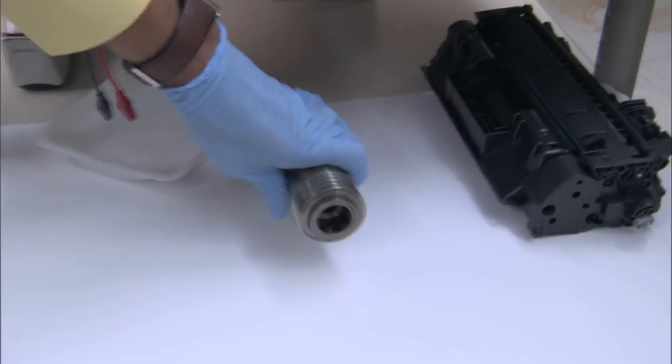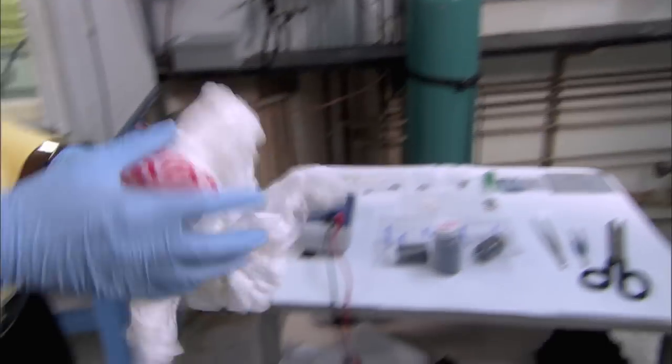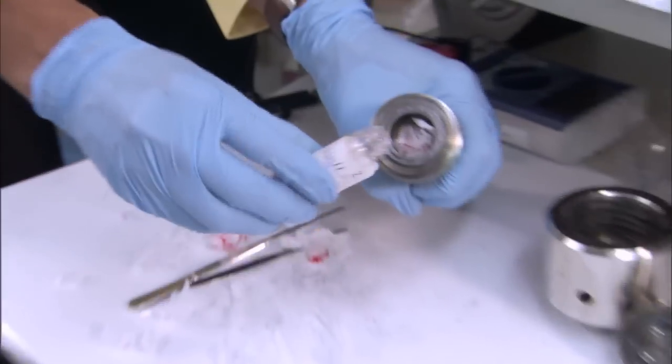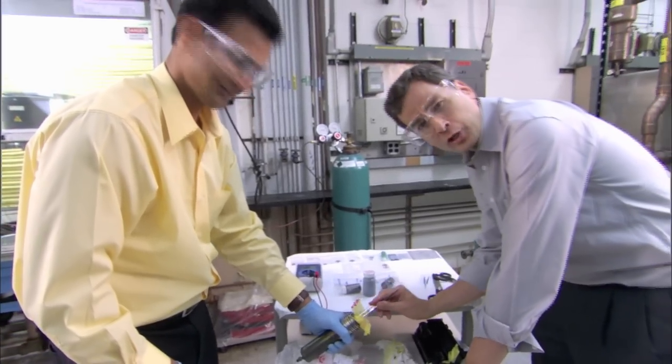The recipe is simple. Cut many plastic bags of any color into small pieces. I feel like the environmental Martha Stewart here. Put the pieces into the reactor. Add a pinch of cobalt acetate. You want to try not to spill?